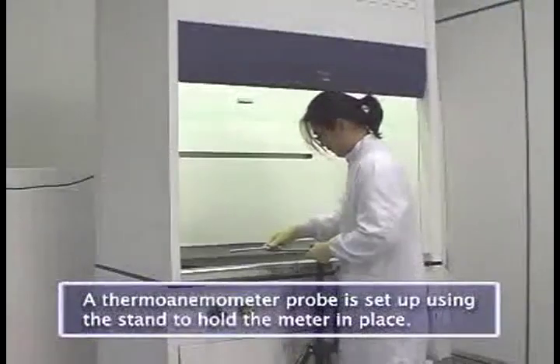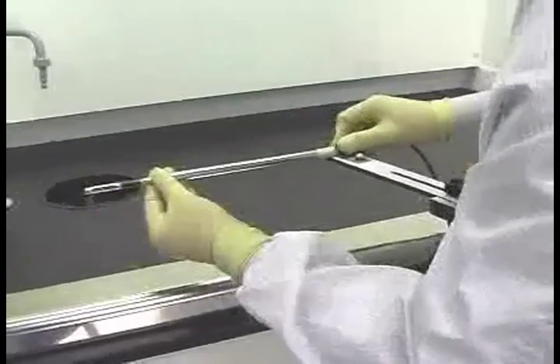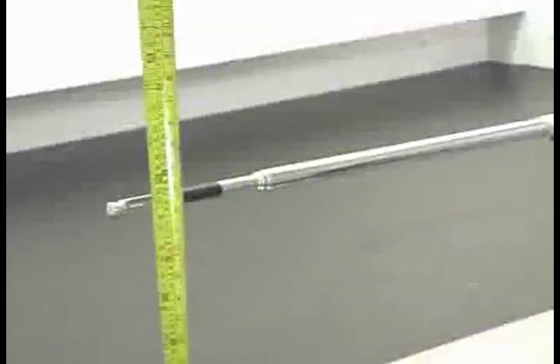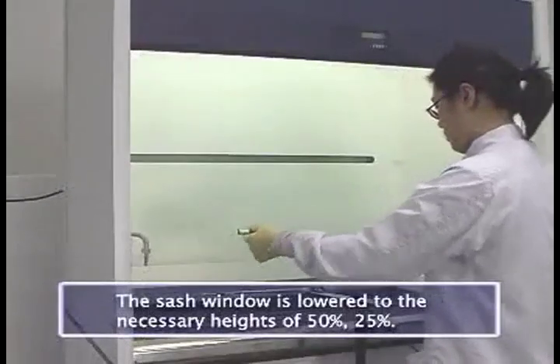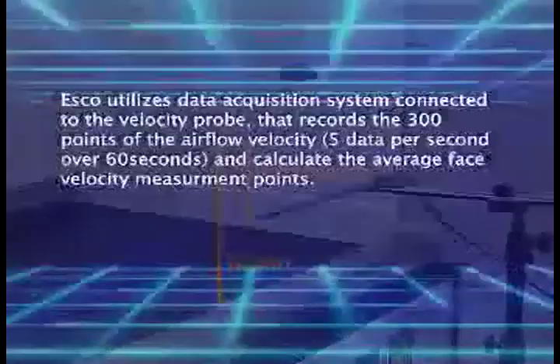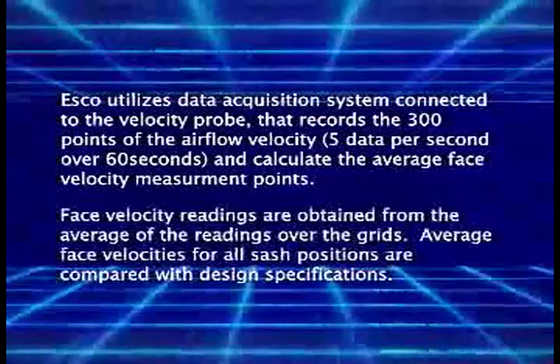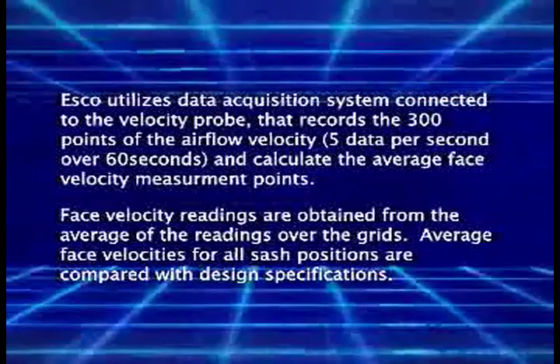A thermo-anemometer probe is carefully positioned with the tip in the center of each grid. The tip of the probe must be carefully positioned in the center of each grid to ensure an accurate reading is taken. After the probe is accurately placed, the sash is lowered to the necessary height. A data acquisition system connected to the probe records airflow velocity at 300 points and calculates the average face velocity at each measurement point. The average velocities for each sash position are then compared with the design specifications for the unit.